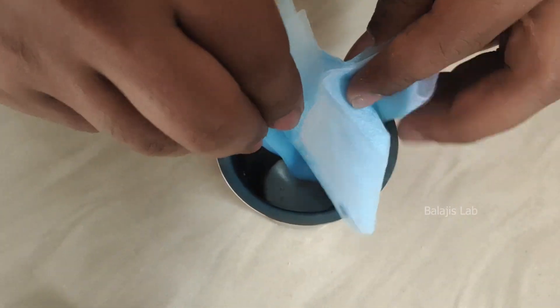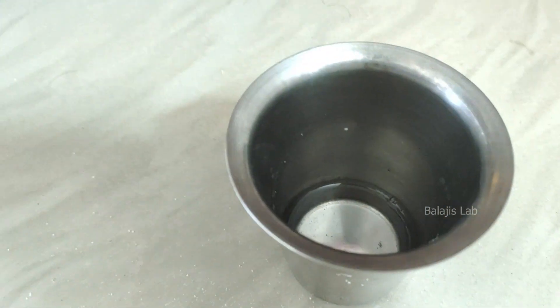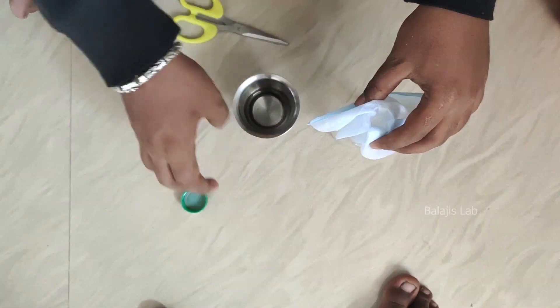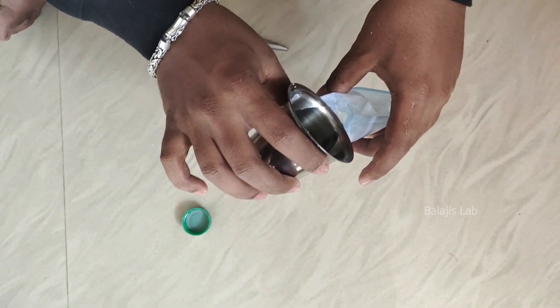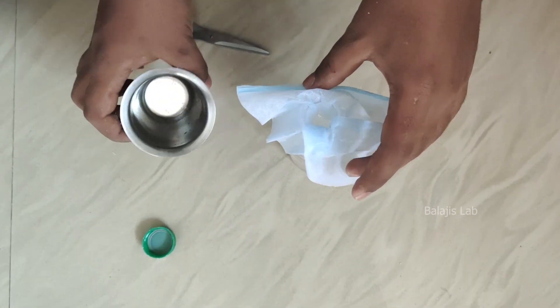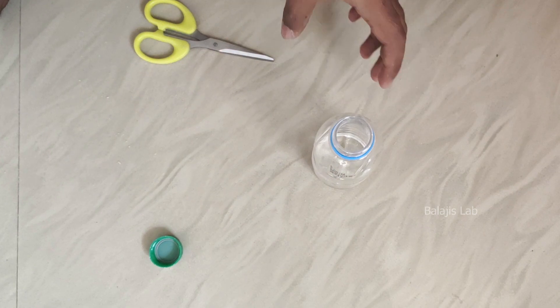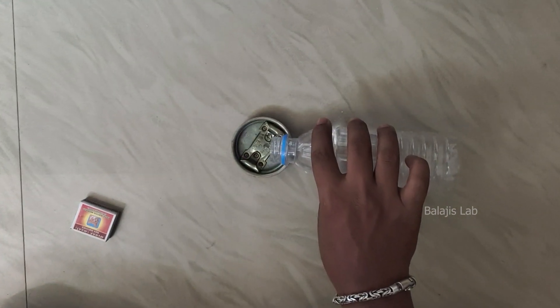The next project is isopropyl alcohol, so I am going to get this isopropyl alcohol. This is very dangerous and poisonous. Now we are going to test this — all sanitizers are mostly flammable, so you can fire it. You can get a tissue if you have any impurities, and you can get 100% alcohol.